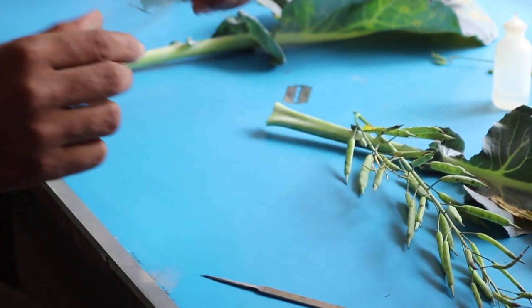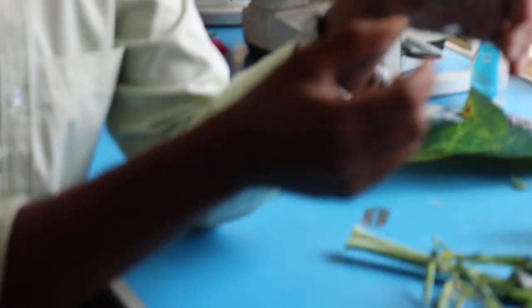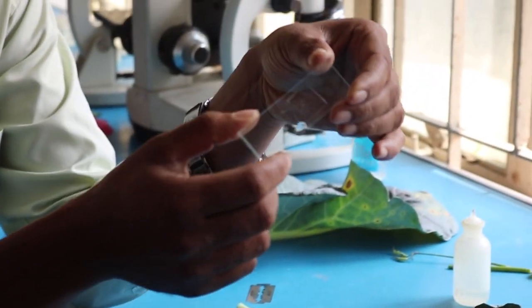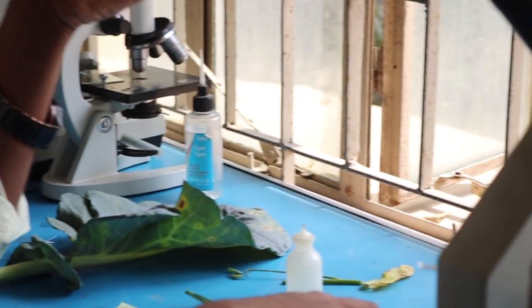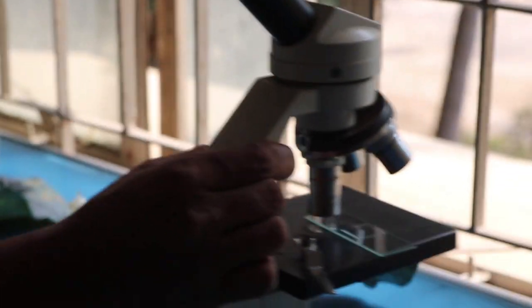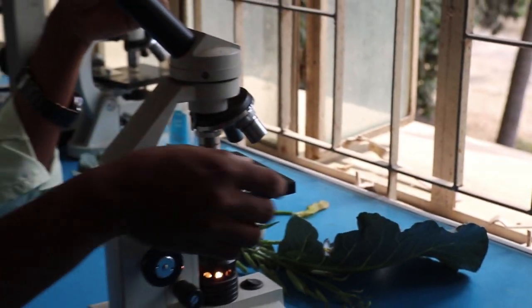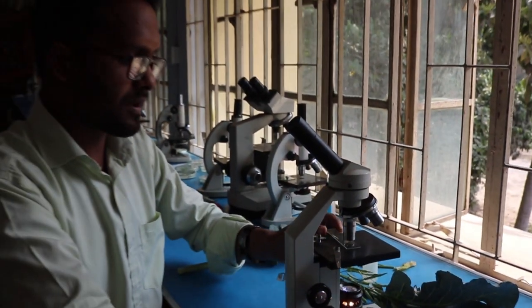We have got this slide, so we can see how to view it under the microscope. We can see it through the camera as well.